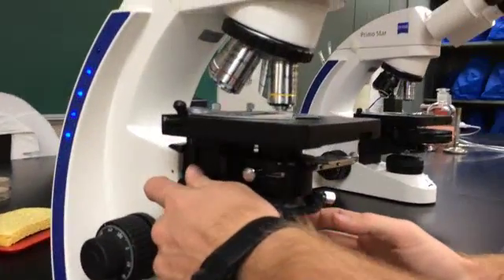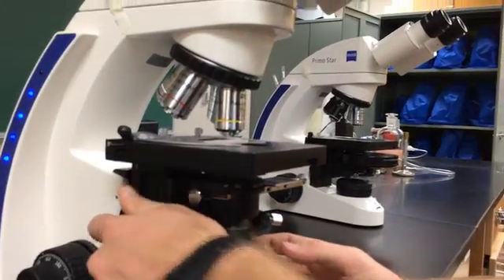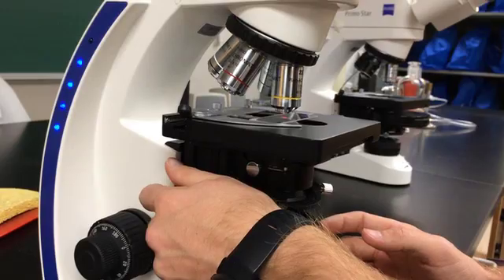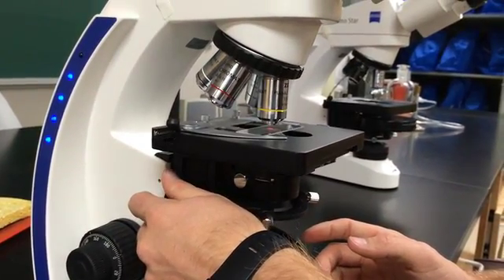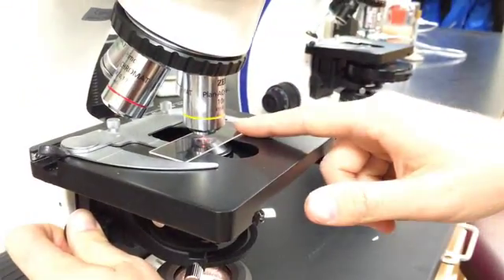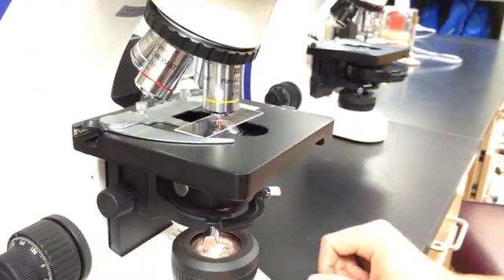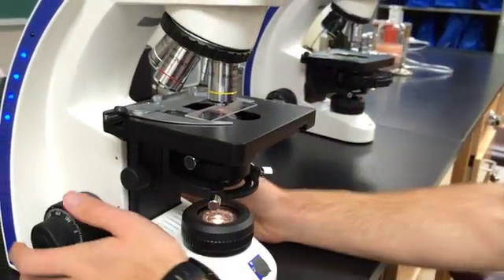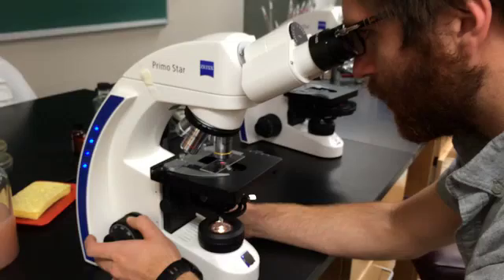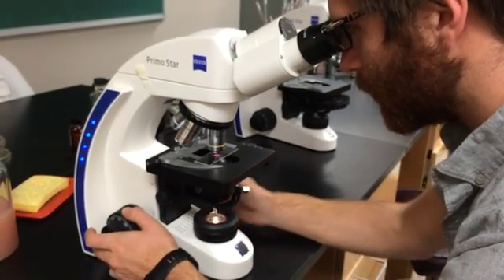And also I'm going to raise this condenser knob up near the top. Almost near the top. See it pushes on the slide so you don't actually want to raise it too high. It'll push on the slide and just pop out the slide. So raise it near the top. Everything is kind of near the top. Now I'm going to look through my scope and focus on the red X. And there I've got it in focus.